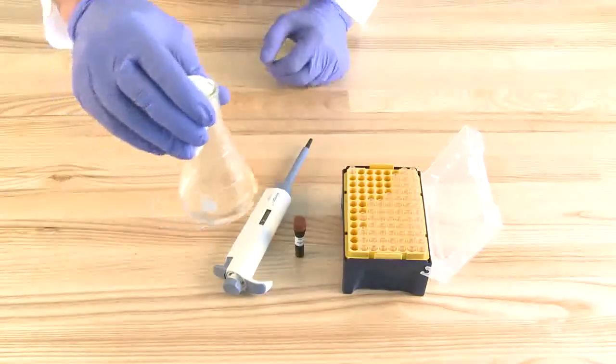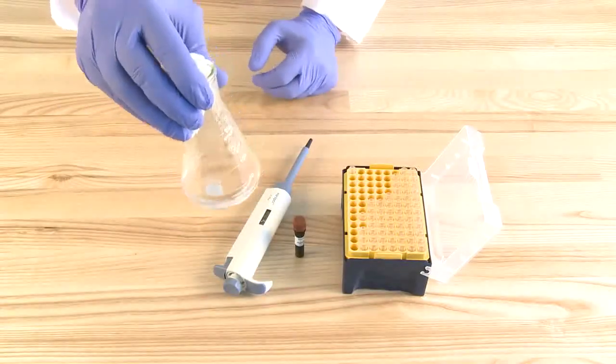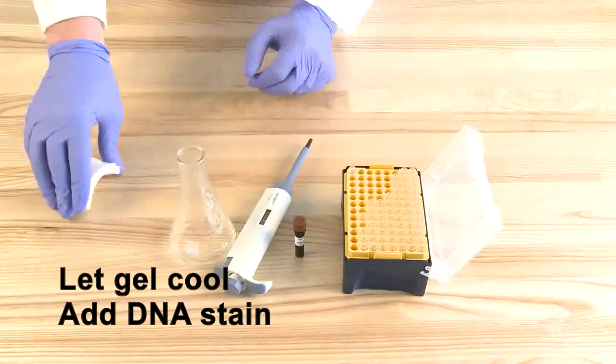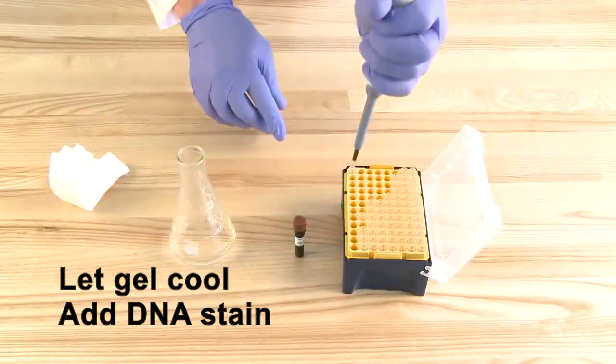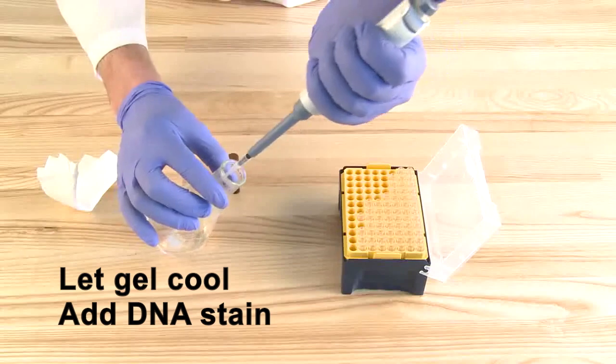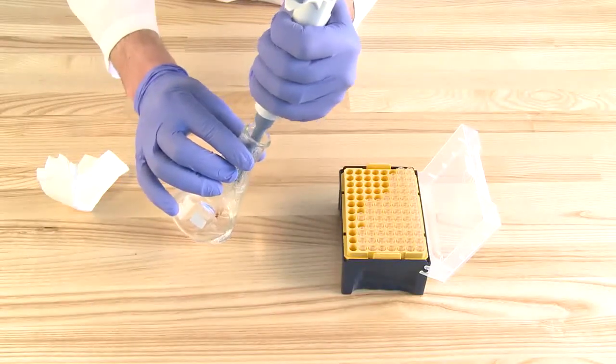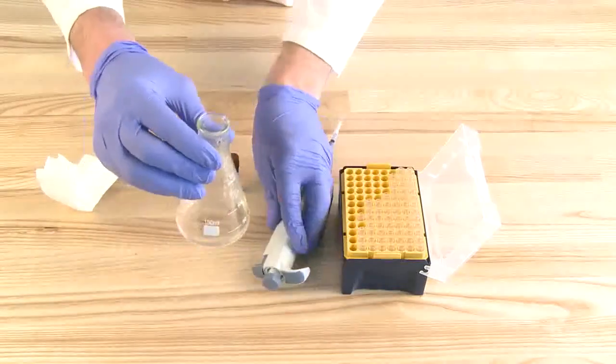Make sure the agarose is completely dissolved. Let the gel cool for 30 seconds to a minute and add 2 microliters of green view plus or other DNA gel stains that work with blue illuminators. Swirl to mix well.